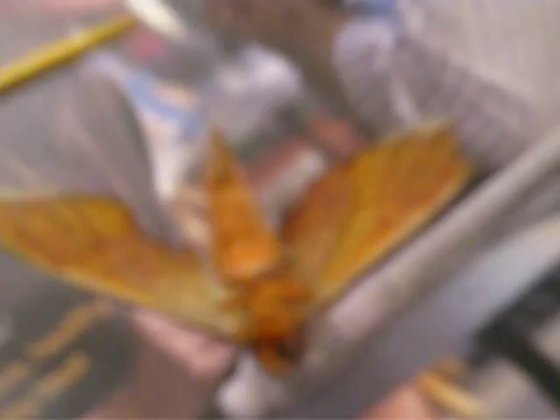This here — I think it may be a sphinx moth. It's of the tomato worm and tobacco worm family in any case. I'm sorry the focus isn't very good.